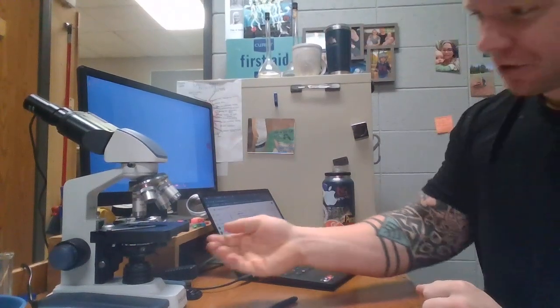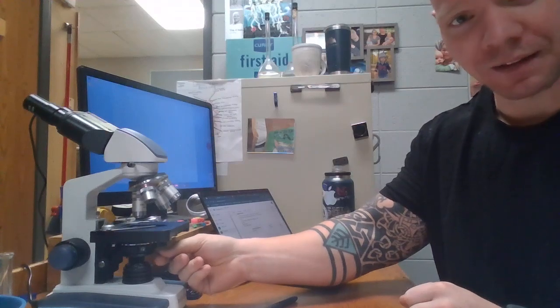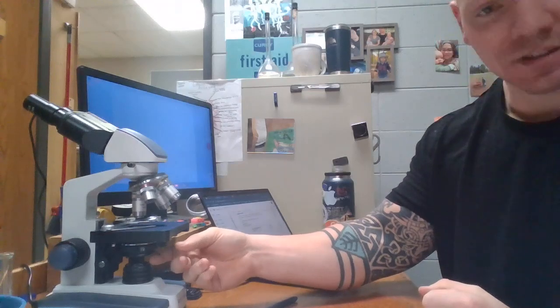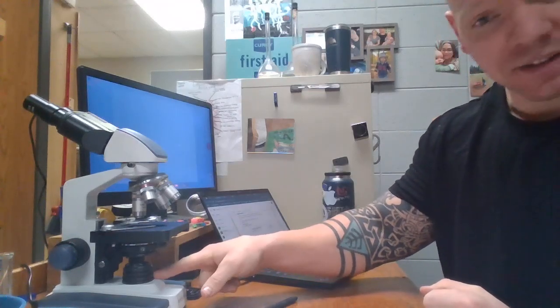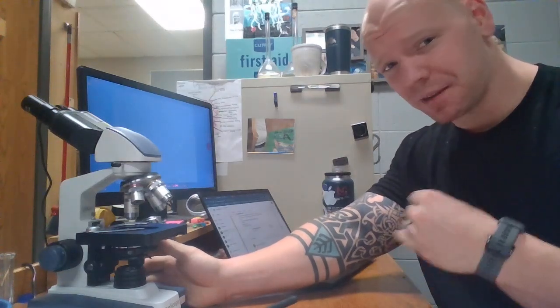Now, underneath our eyepieces, we have the stage, and then underneath that we have what's called the diaphragm. And similar to your diaphragm, which allows for more or less air, this allows for more or less light to be let in. Underneath there is our light source, and then towards the back of here, you guys cannot see, there is a dimmer switch, right? And that dimmer switch allows for more brightness as well. By adjusting both the dimmer and the brightness at the same time, I'm going to be able to see a lot of different colors in my slide, and that makes it very useful.